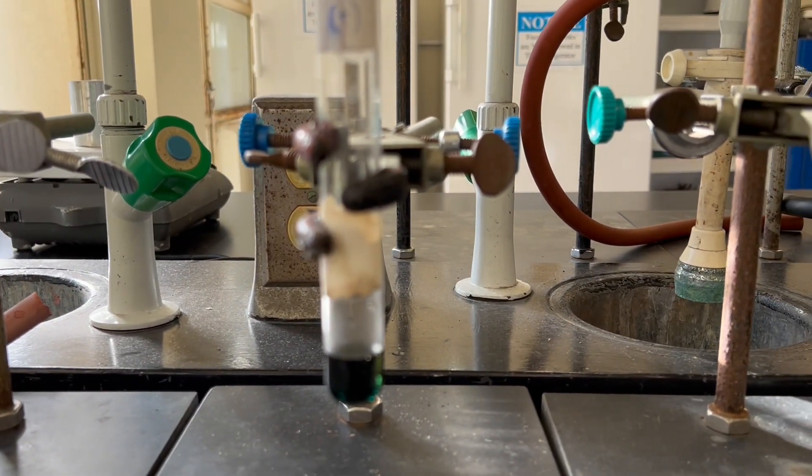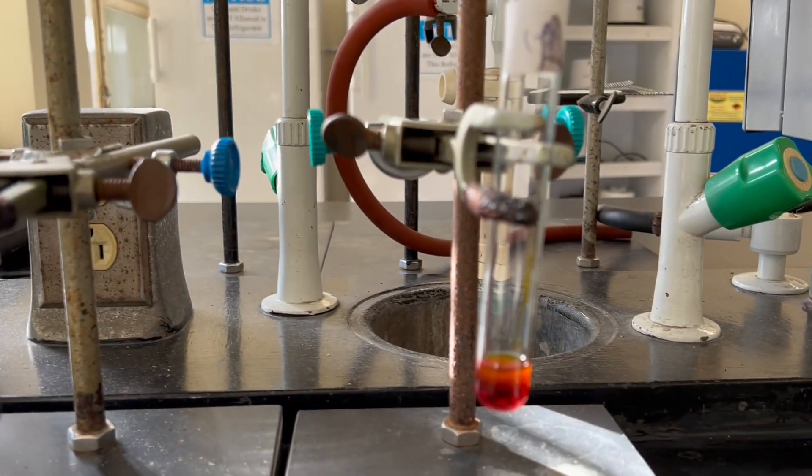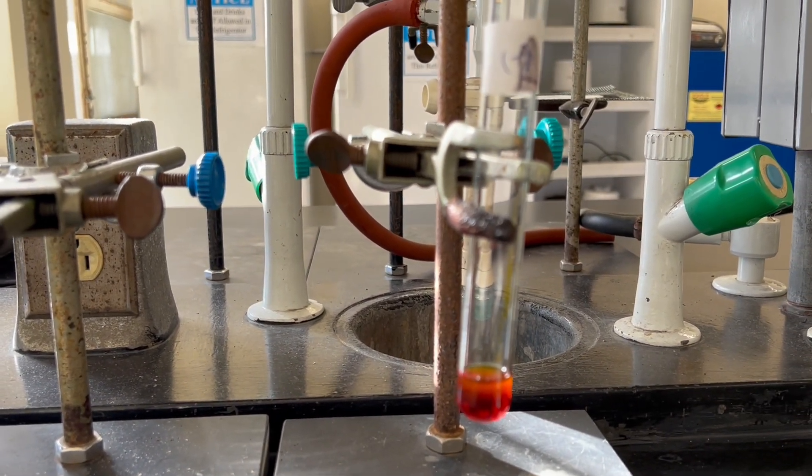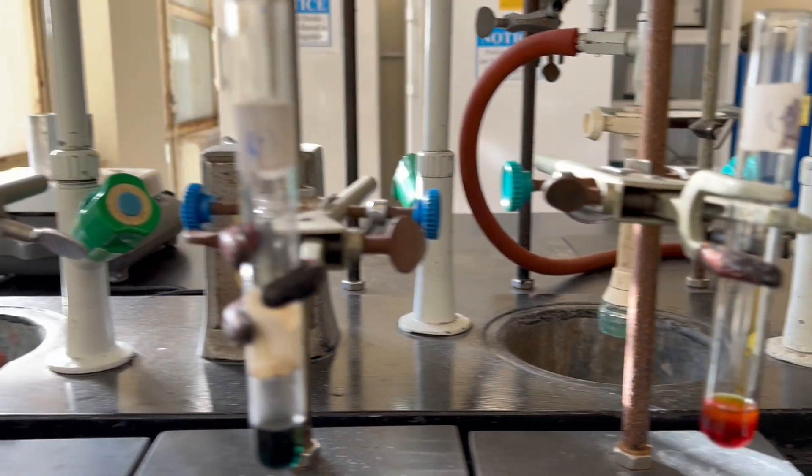Whereas in the negative control, we see that the color of the Jones reagent remains unchanged, thus indicating a negative test.